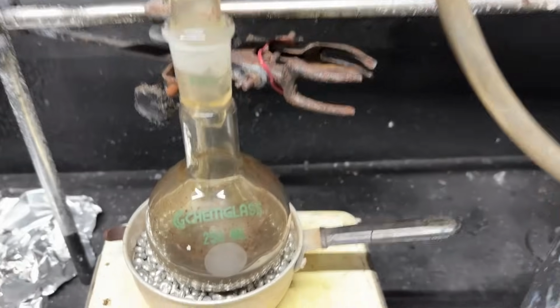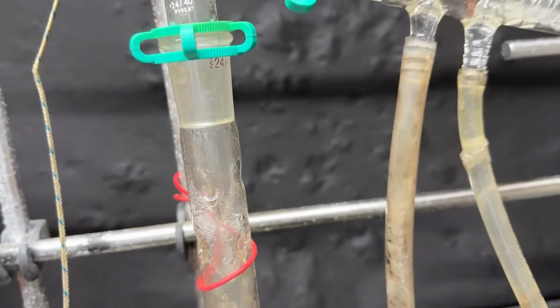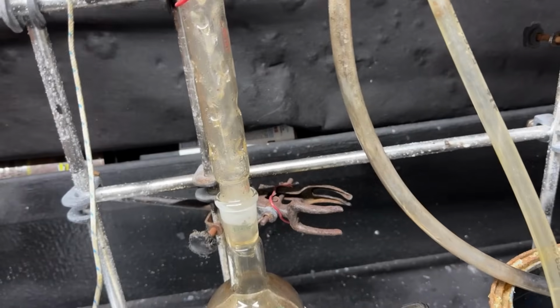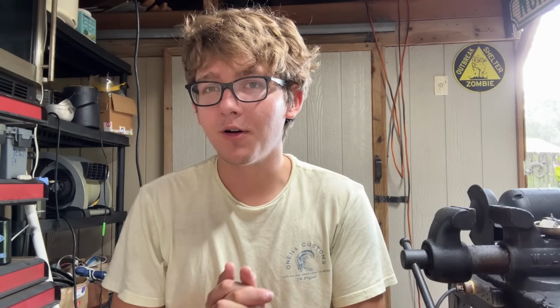Now, at the very end, there was some fusel oils, but due to the size of my distillation setup, I couldn't extract all the fusel oils, not even close, because it kind of just wetted the outside of the glass, and that was all there was, and I couldn't heat it anymore because it wasn't going to get pushed up. So there was fusel oils in there, it just wasn't enough to get any discernible amount of isoamyl alcohol out. So sadly, my attempt at getting isoamyl alcohol from a local distillery failed.